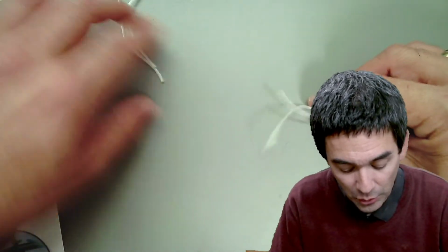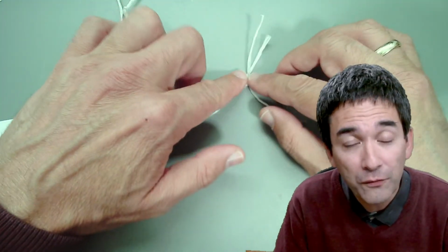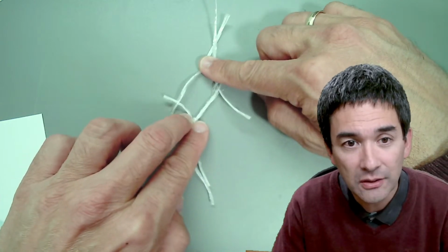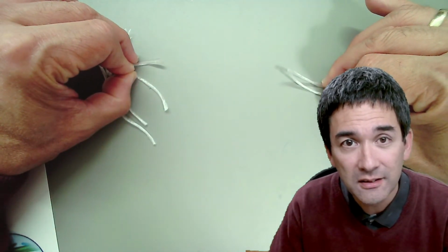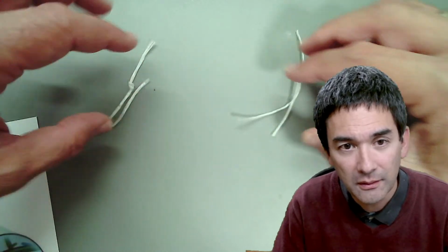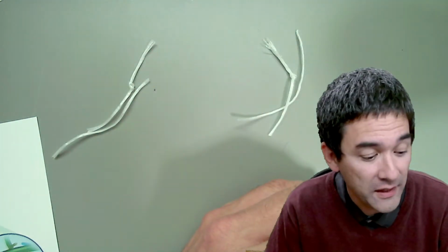So I just want to show you over here. Again, at the beginning, you have prophase, where the chromosomes start to appear. Then metaphase, where they start to line up in the center. The next one is where they're separating. This is called anaphase. And when you have the DNA separated and the cell actually starts to divide, this is called telophase.